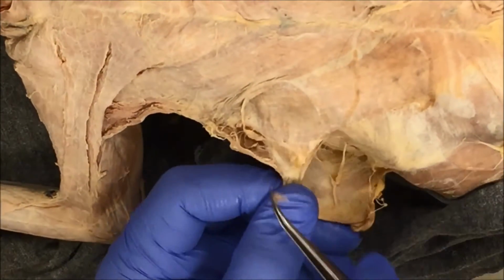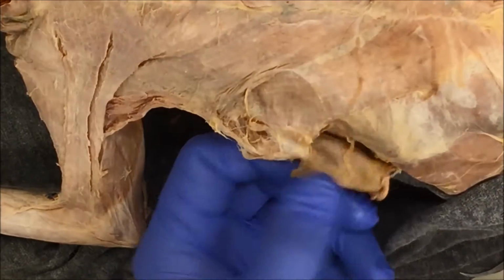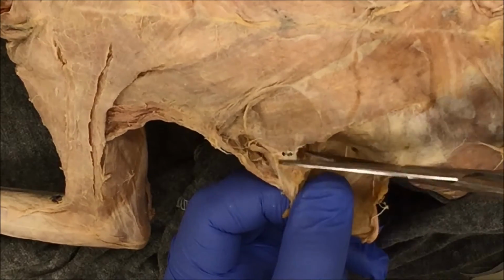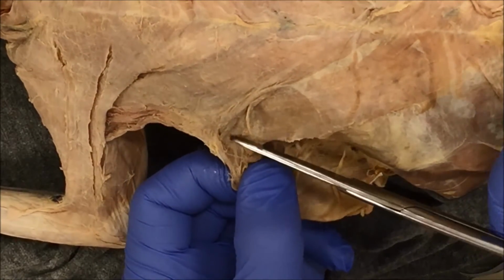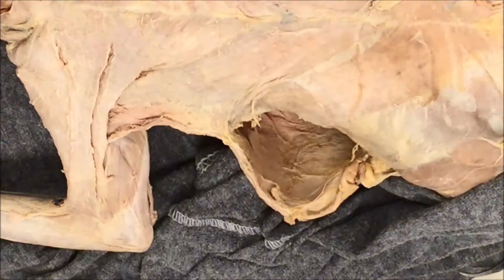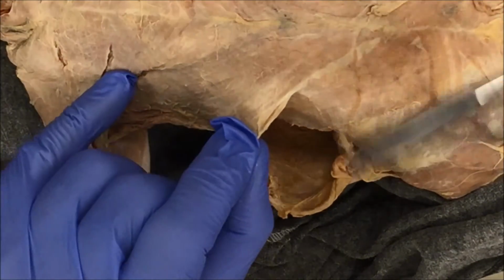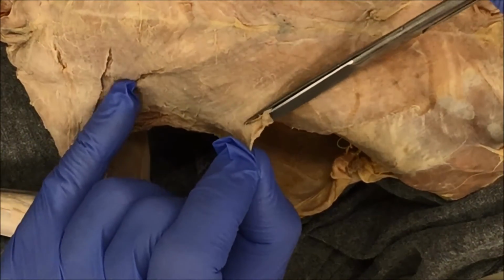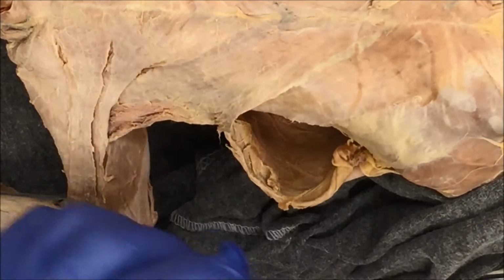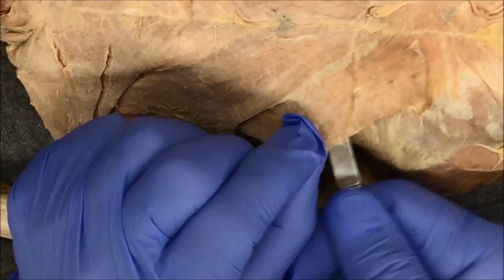So I can see here's the boundary, connective tissue and the xiphohumeralis. I'm just going to go ahead and take my scissors and just cut. It'll save me some time with the dissection. And that's as far as I want to cut here. Next, I'm going to spend some time now removing any excess connective tissue off of the pec minor, right? So that now I can get to the xiphohumeralis. So here's the bottom part of the xiphohumeralis, right?